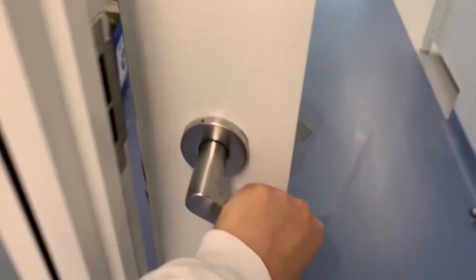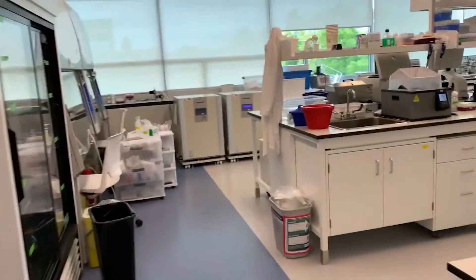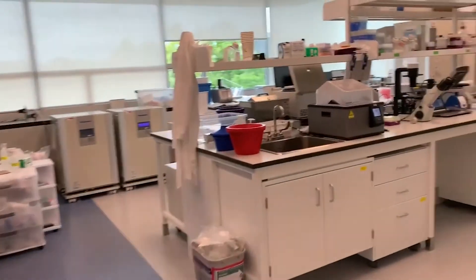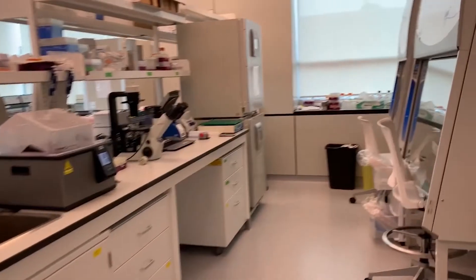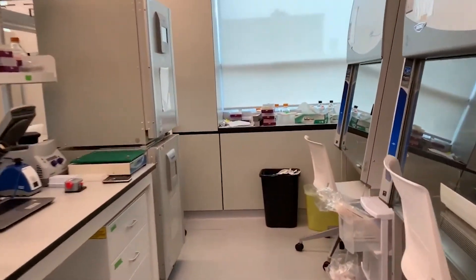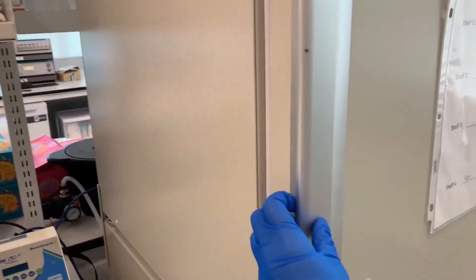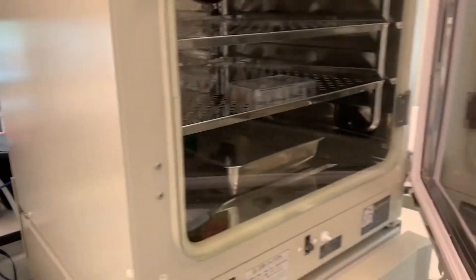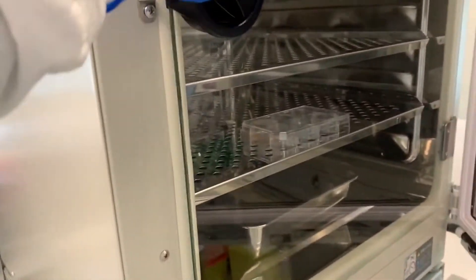Let's move to the cell culture room. This is where the magic happens. Here, we have biosafety cabinets, regular cell incubators, and hypoxia incubators. Do you want to see some live cells? Come with me — we have them here in this incubator.